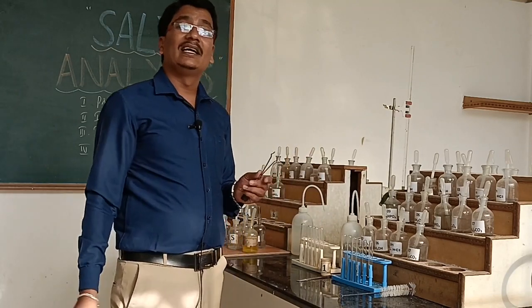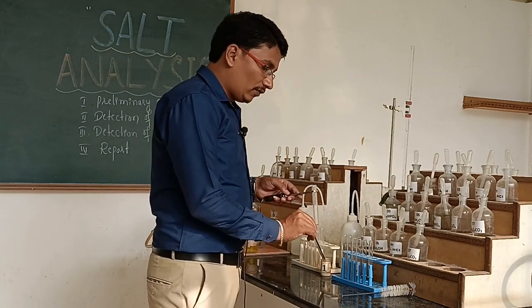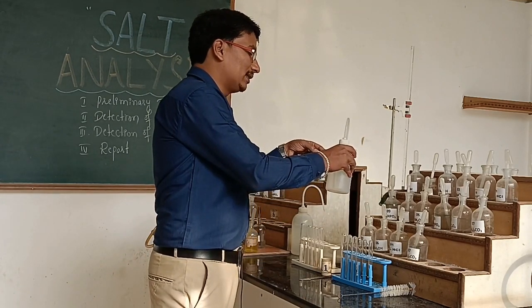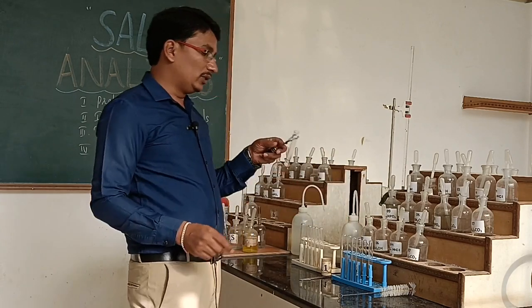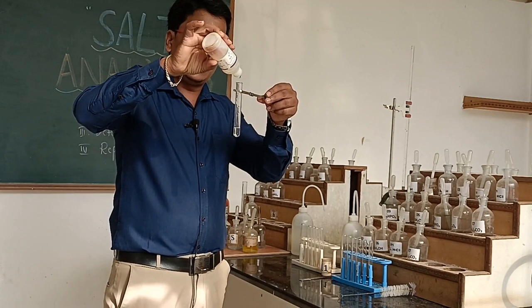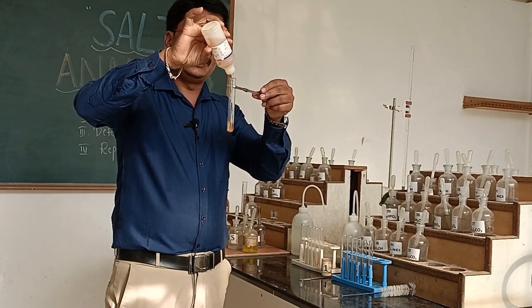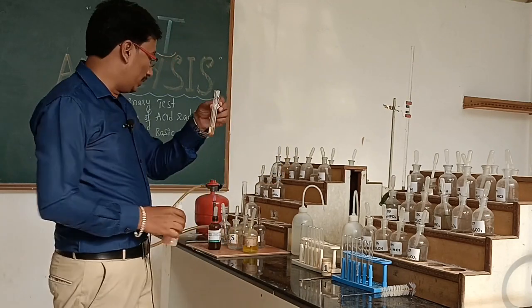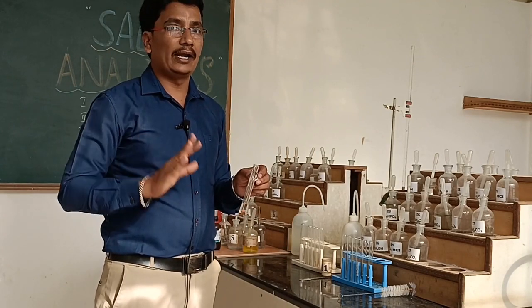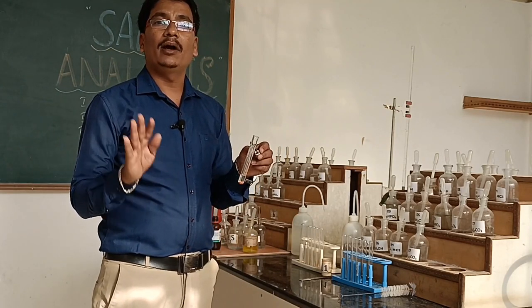We now conduct the confirmation test for ammonium ion using Nessler's reagent. We prepare a salt solution using water. To this salt solution, we add Nessler's reagent. If a brown precipitate forms, the given salt confirmably contains ammonium ion. Hence, the acid radical is chloride ion and the basic radical is ammonium ion, so the given salt is ammonium chloride.